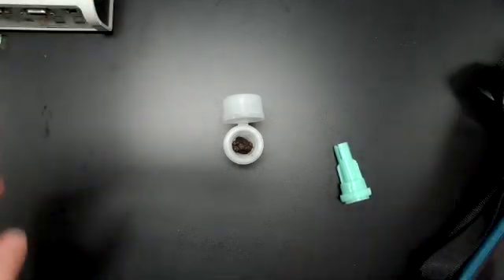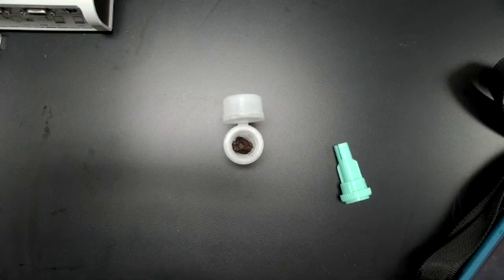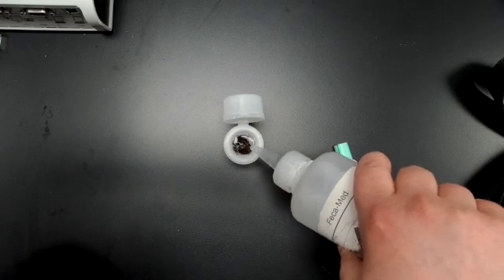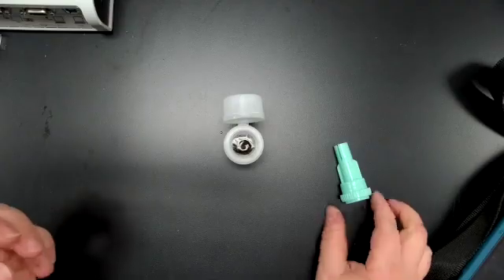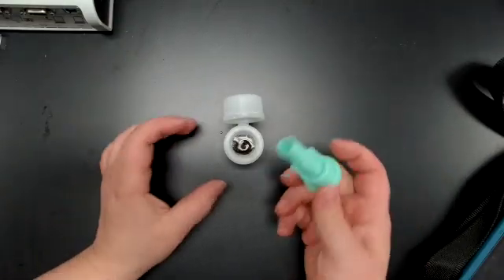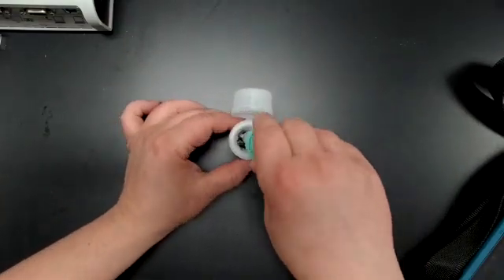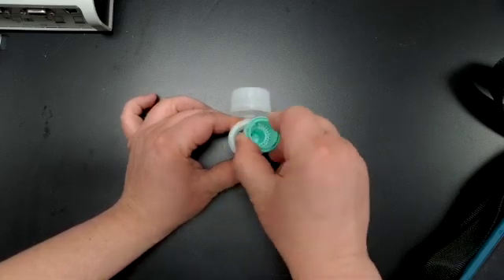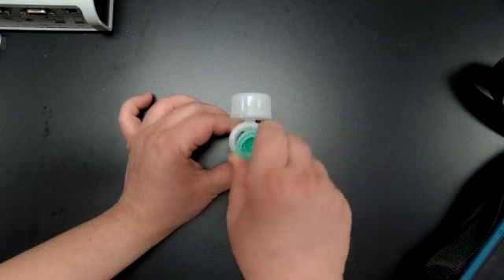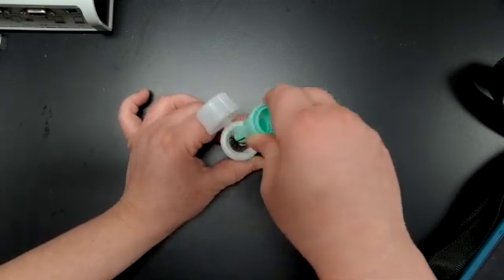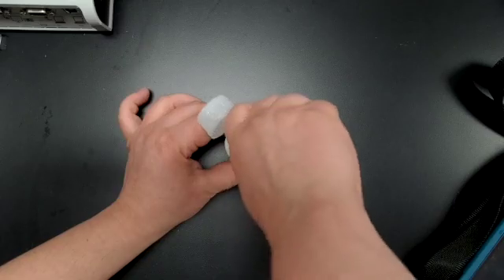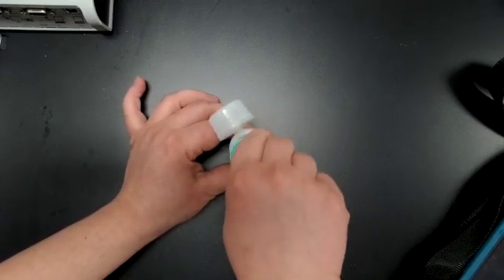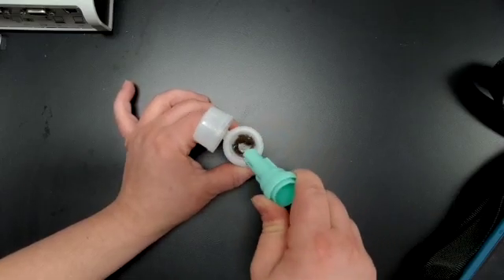So my feces in there, I have a fecal flotation solution, fill about halfway. And then I'm going to start using the insert to grind my feces. I'm going in up-down motions to break up that dehydrated consistency of the feces. And you can see it start to break up.